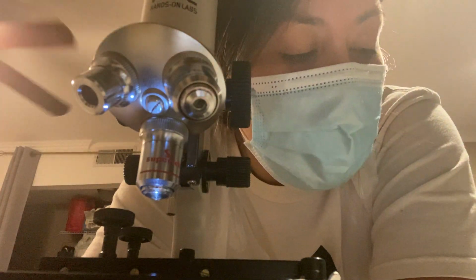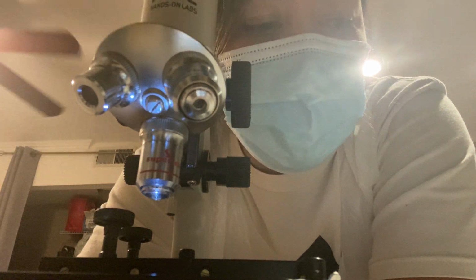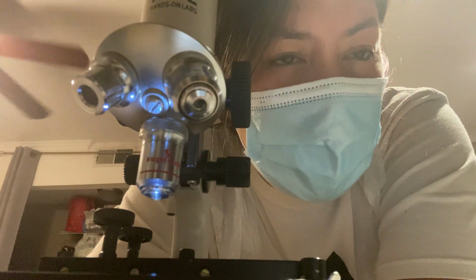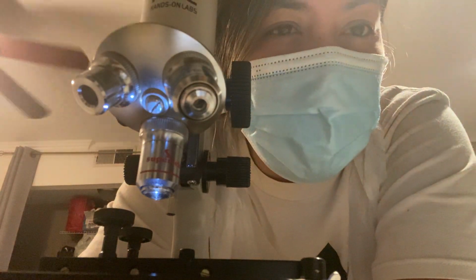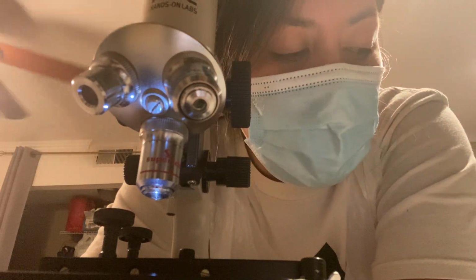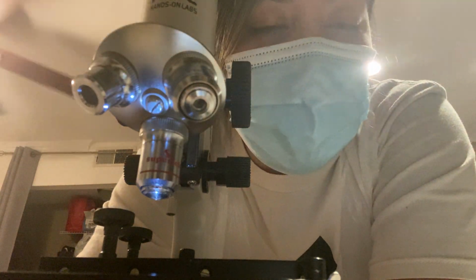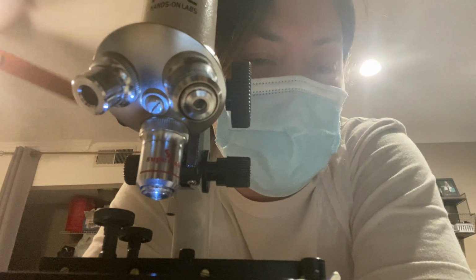The E. coli had a completely different pattern than the S. epidermidis and the S. cerevisiae. It was more uniform and more visible to see with that one. The best way I can describe it is more like an animal print, kind of like tiger stripes. It was very uniform in a way. And parts of it were darker than others, and I'm not sure if that was from the staining or not, but overall that one was the most visible to see.